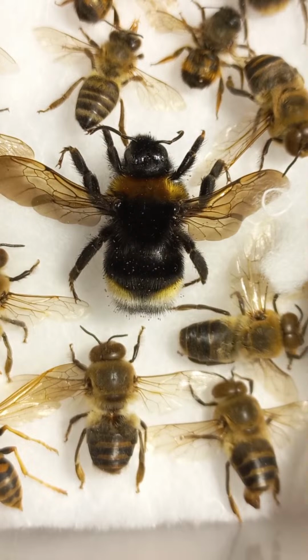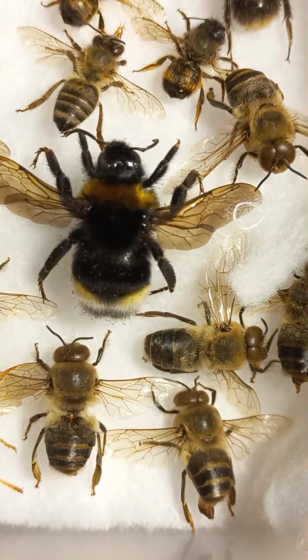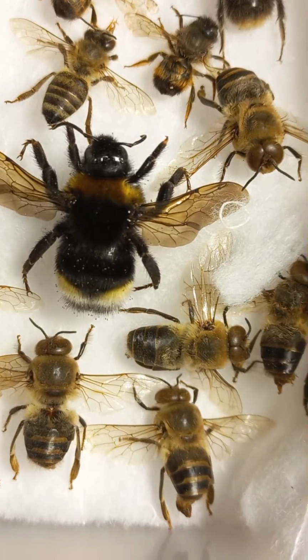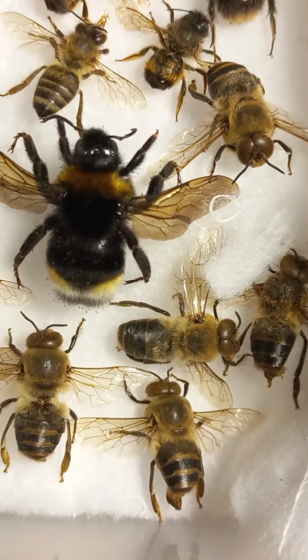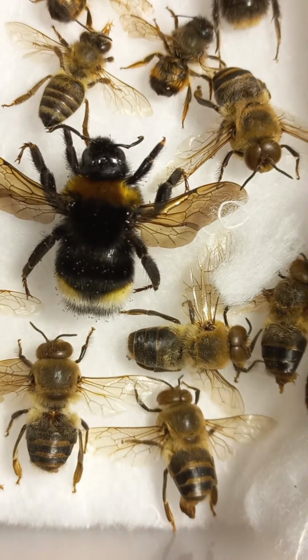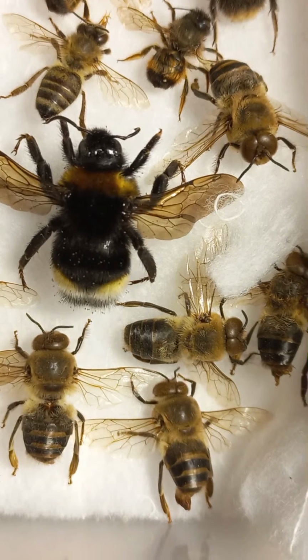And here, 3 different but quite similar drones of honeybees. 4 drones. As we have recognized with drones, they have different hind legs. They are not collecting pollen. They have no sting. They have no wax glands, so they do not produce wax. They have male reproductive organs, which are intended for mating and for reproduction activity.